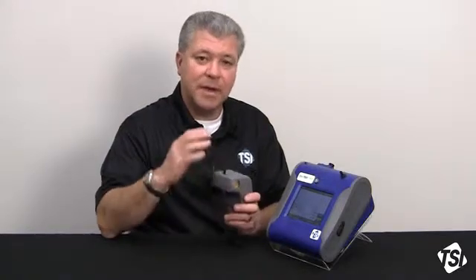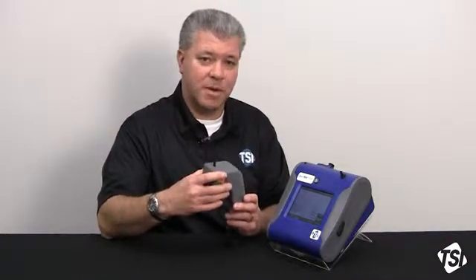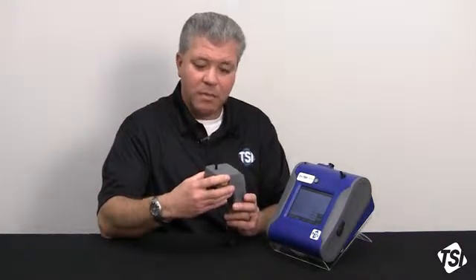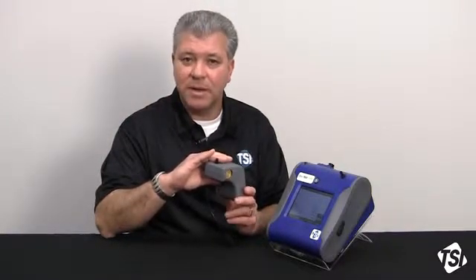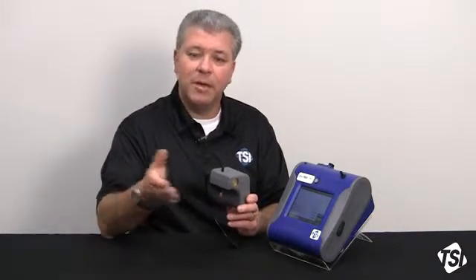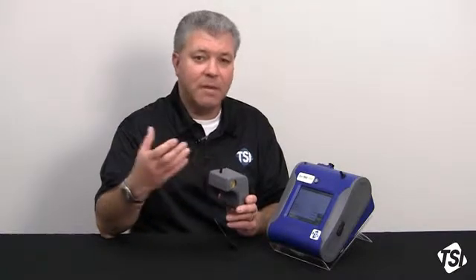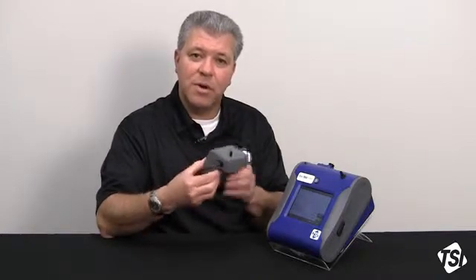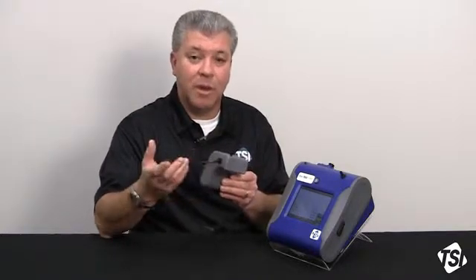Now, there's a couple of things with the Auto Zero module to note. The most important thing is that your logging interval can be affected. With the use of the Auto Zero module, you can't go any shorter than a 2-minute logging interval. The reason is, once you start, an Auto Zero will take 60 seconds. If you're doing that at less than a 2-minute log interval, you may affect more than one data point. We're trying to affect the least amount of data points possible.